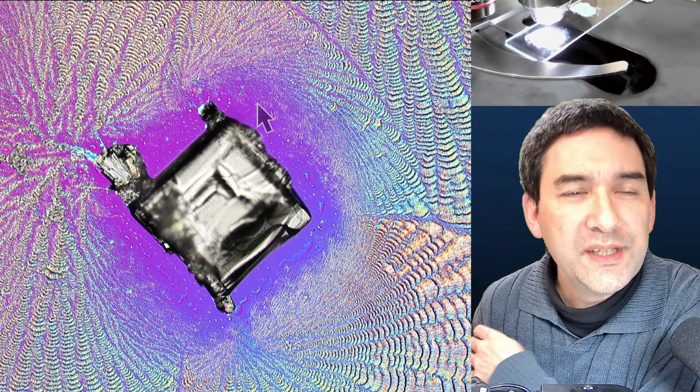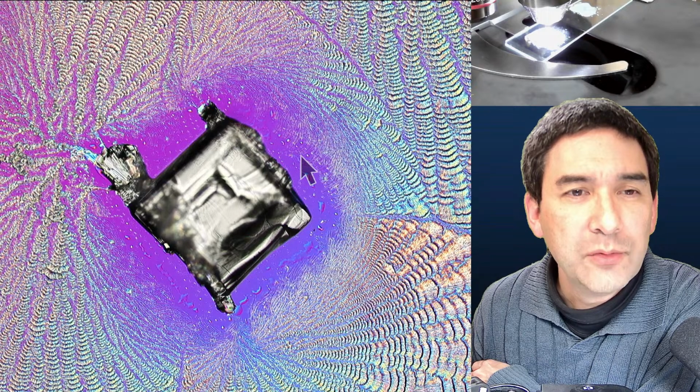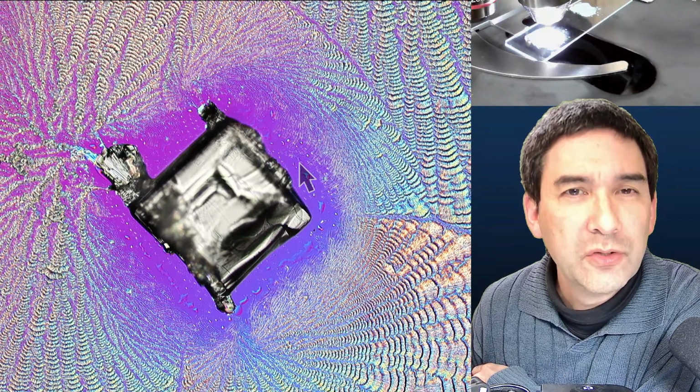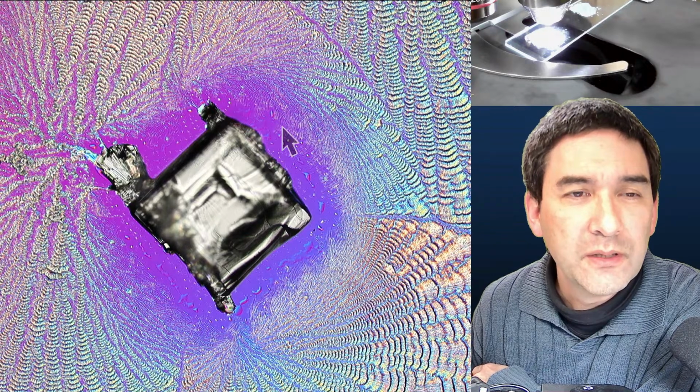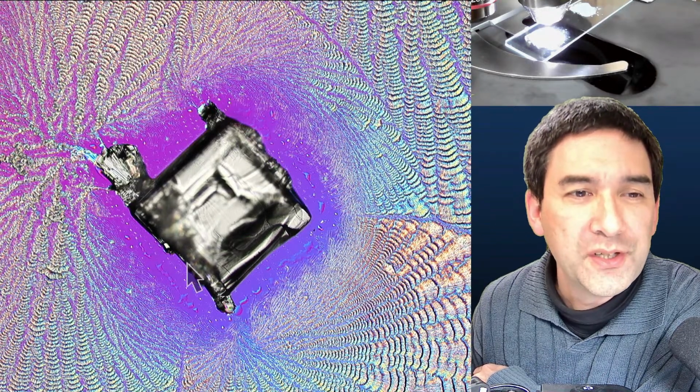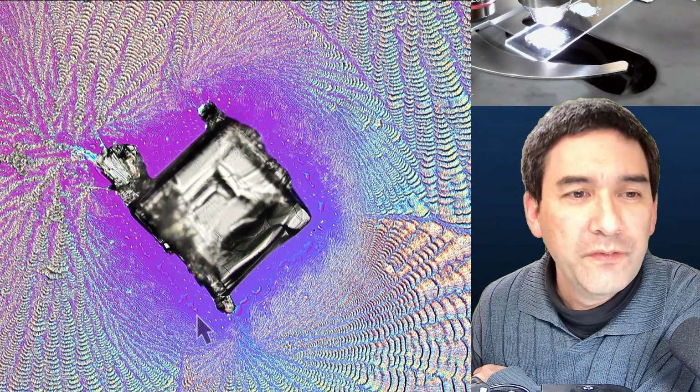And I think the reason is that the vitamin C that was here started to be deposited on this main crystal here. Yeah, so it diffused and then started to become deposited here, and that's why we have an area here of very little vitamin C.